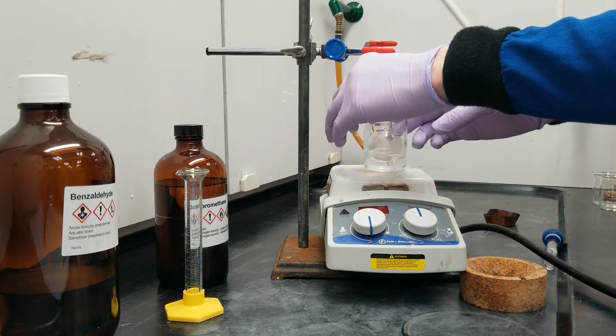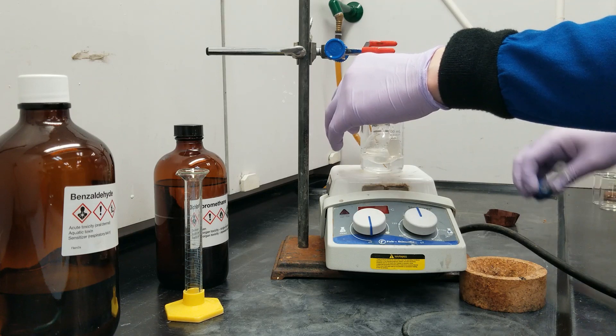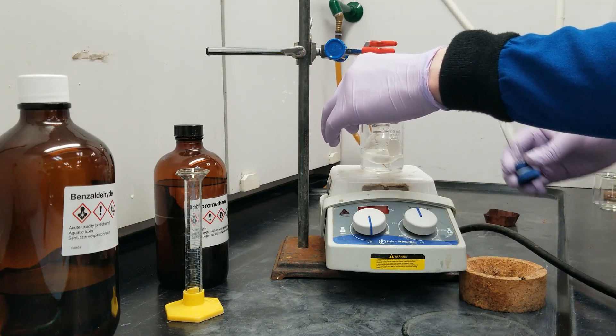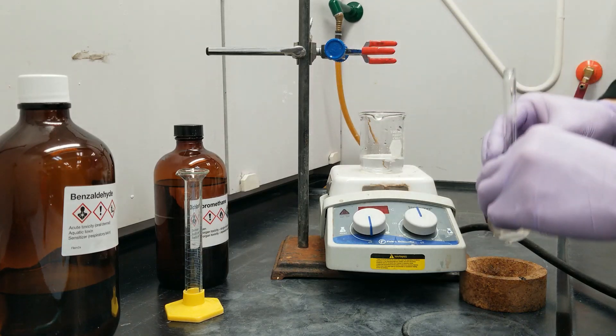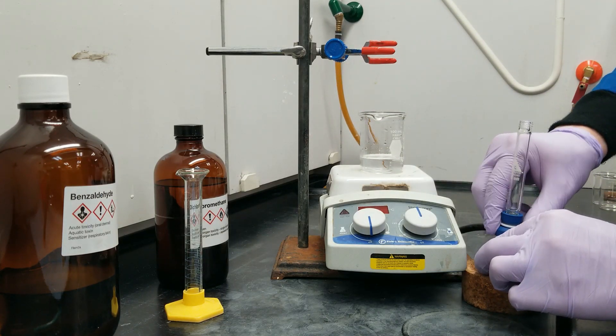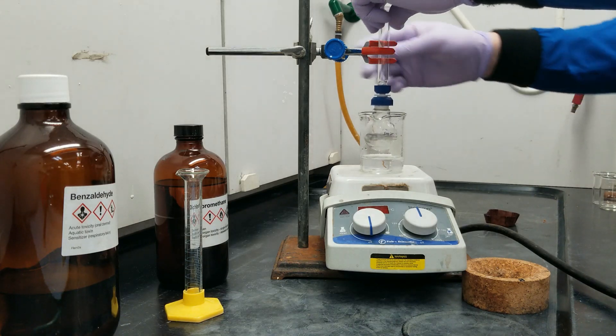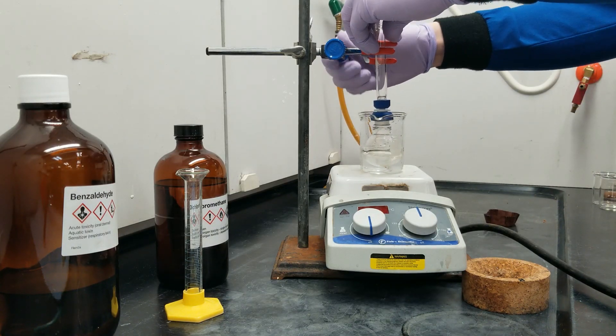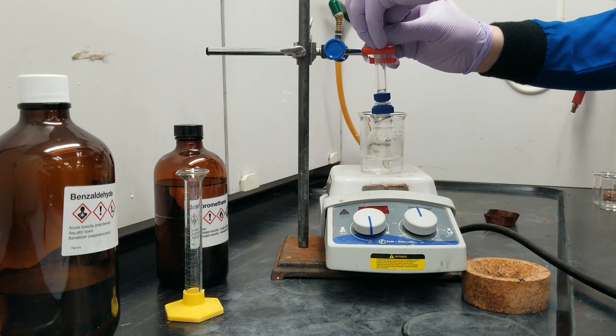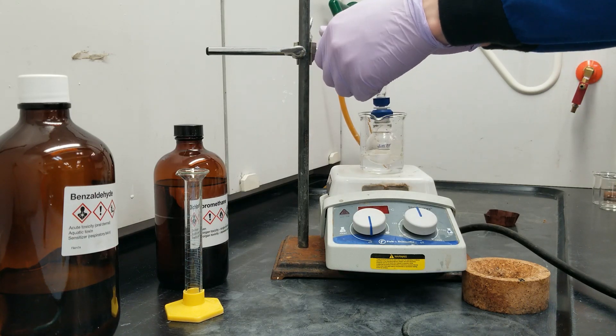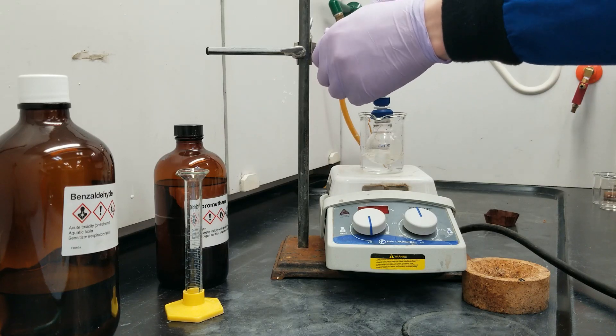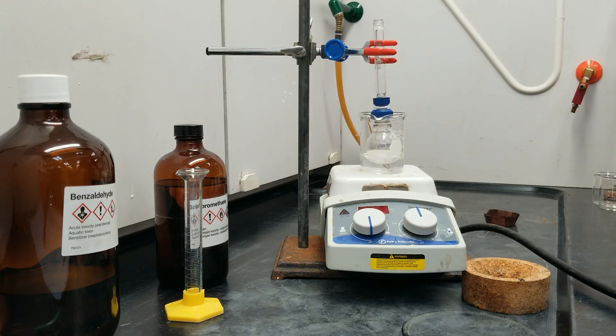Okay, and this worked really well. I saw a minimal amount of well-controlled bubbling but definitely not a violent reaction. And now that the reagent has been added slowly and safely over a couple of seconds, we're going to go ahead and allow another 10-minute reaction time.